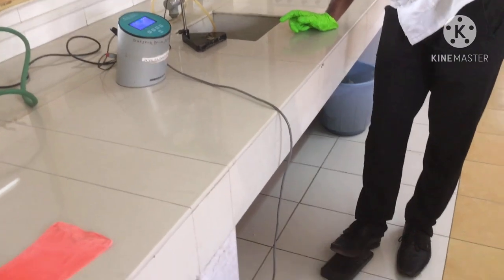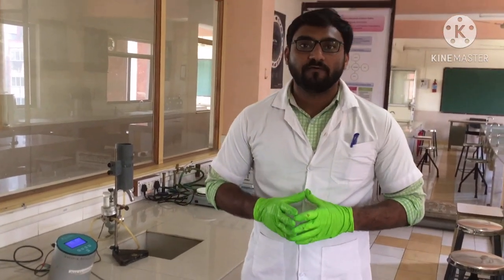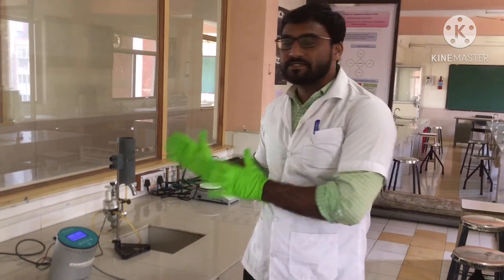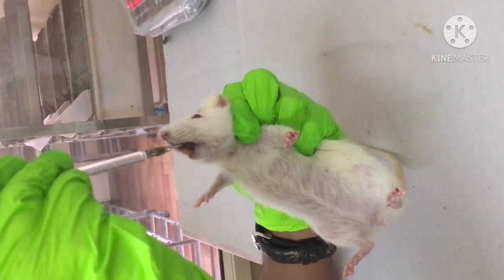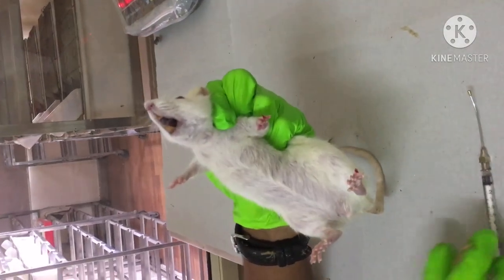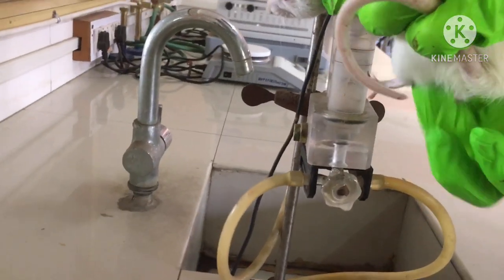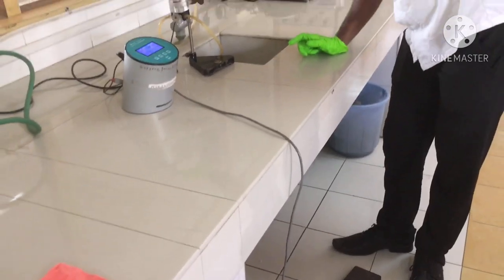Now it is stable — we have to record using this pedal. After giving a dose of 1% carrageenan by the subcutaneous route in the plantar region of the rat, and after a gap of 3.5 hours, we are taking the result of edema or inflammation. Now we are giving indomethacin anti-inflammatory drug, 1.79 mg by the oral route dissolved into saline water. The volume of saline water has been calculated as per the body weight of the animal. This is the final result of anti-inflammatory activity after giving a dose of indomethacin.